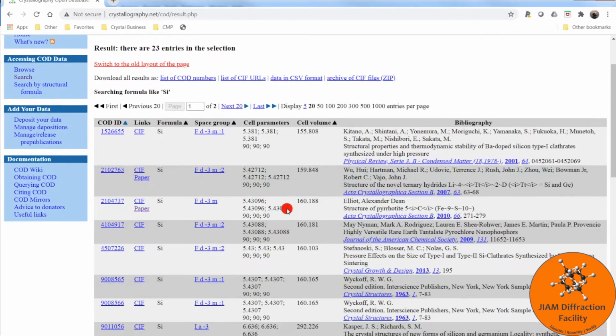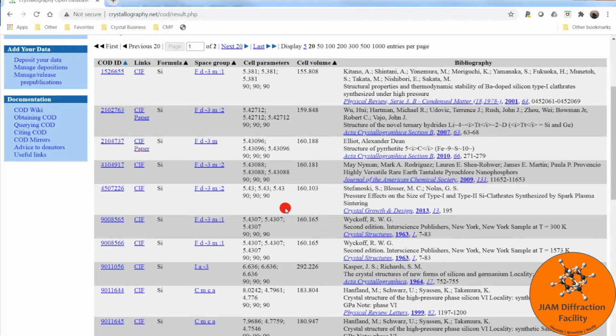And here we see a whole list of CIF files that we can choose from. The first column we see is the Crystallography Open Database ID number. Here we have links. If you click CIF, that will download the CIF file. Paper will open a new web page that has more information about where the CIF file comes from.